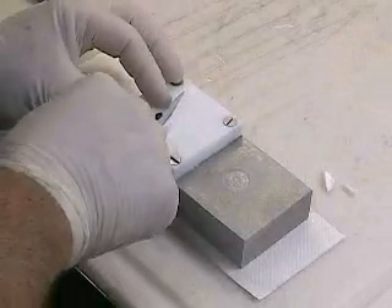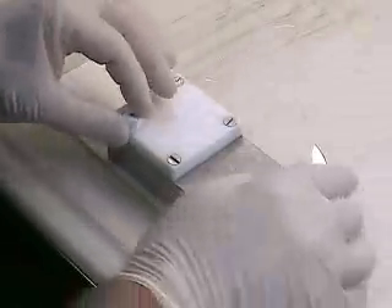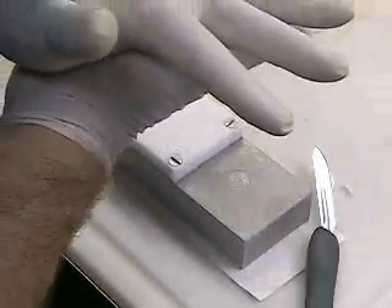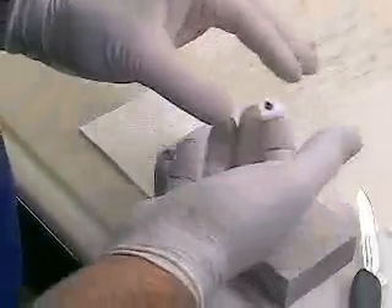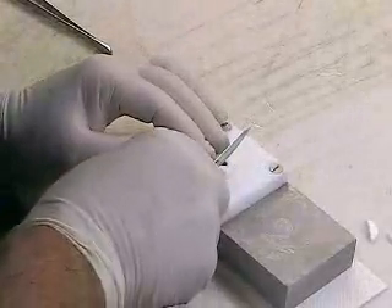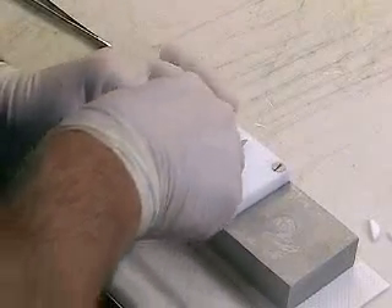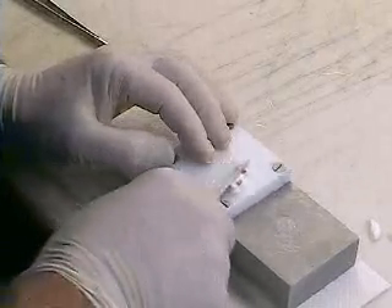If it flies like you just saw there, that's supposed to be a little bit cold. We're going to do just a little something to warm it between our hands — just hold it for a second and that will warm it. Now with such a thin piece of tissue, just make sure that the face with the tissue on it is frozen, so I'll put it back down there for a second. Now I can take this piece of tissue and just cut it like I would a larger specimen. And there's my central section.